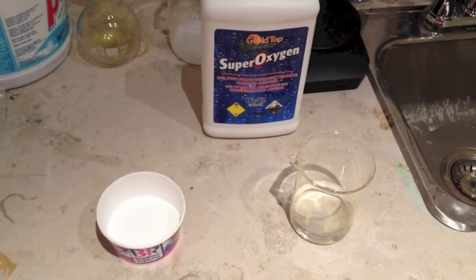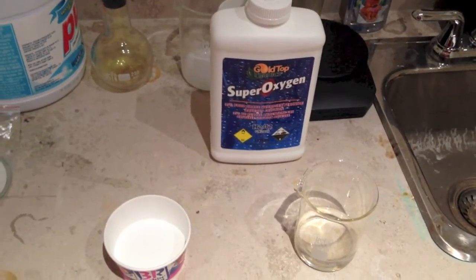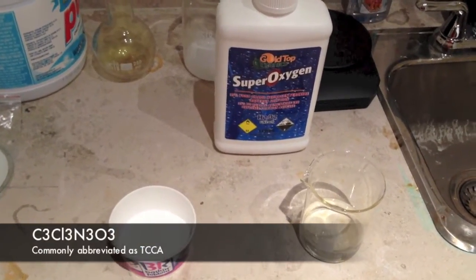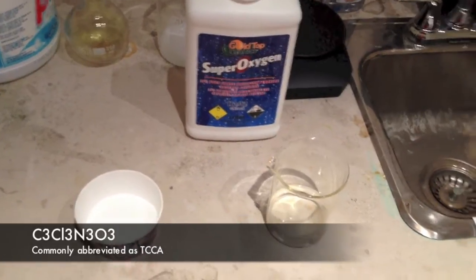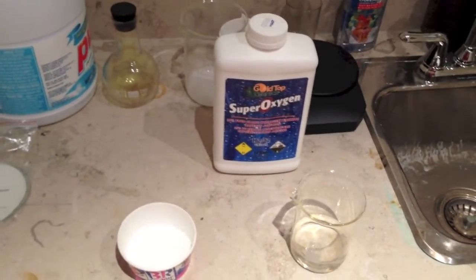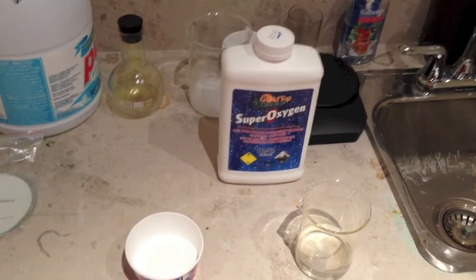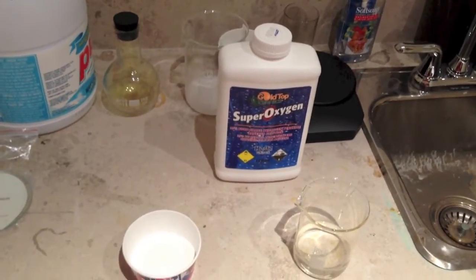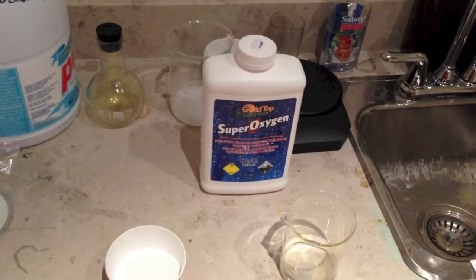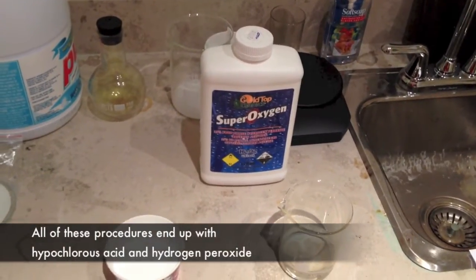Also, this same effect can be seen with the addition of trichloroisocyanuric acid into hydrogen peroxide. Trichloroisocyanuric acid is also available as a pool chemical. Another way to view this reaction is through bubbling chlorine into an aqueous solution of sodium hydroxide and hydrogen peroxide.